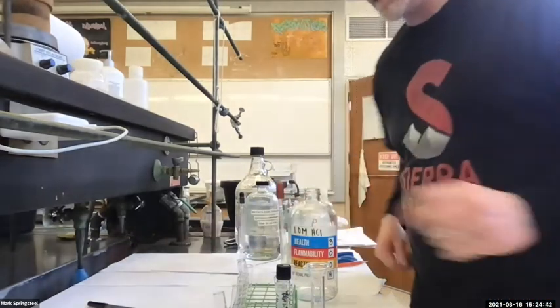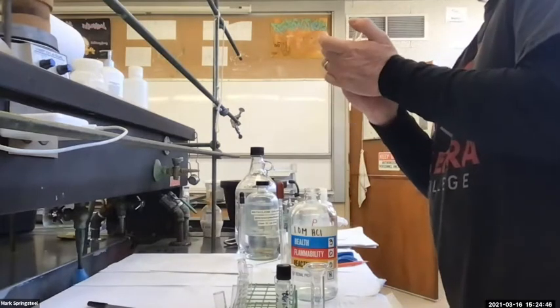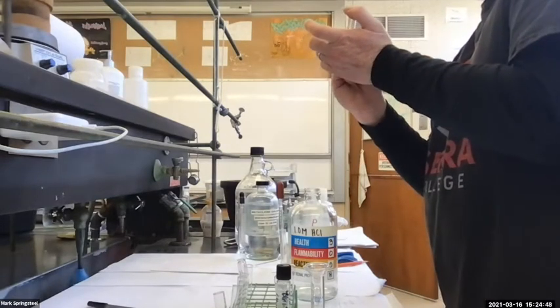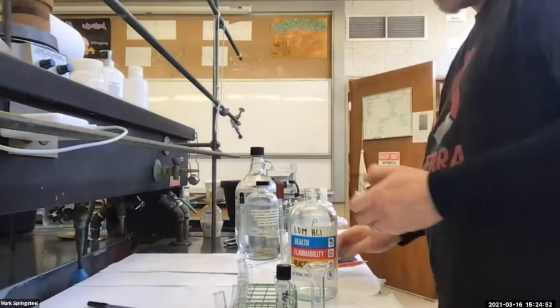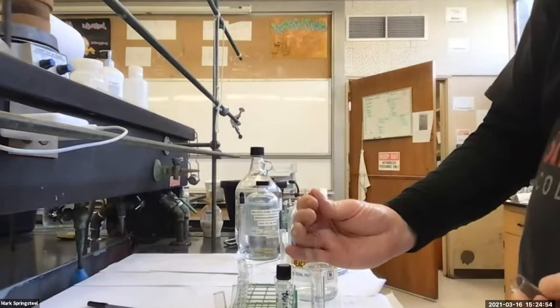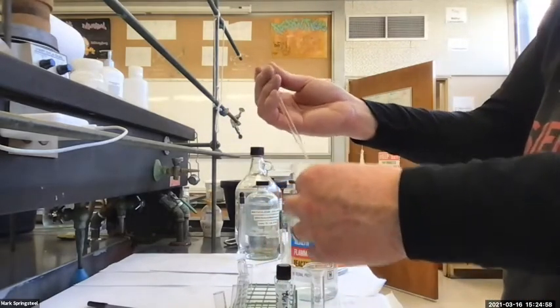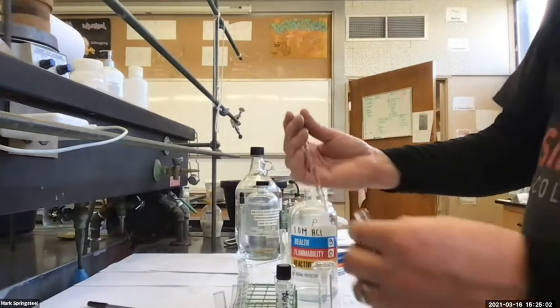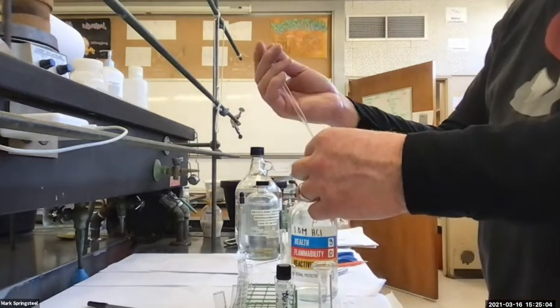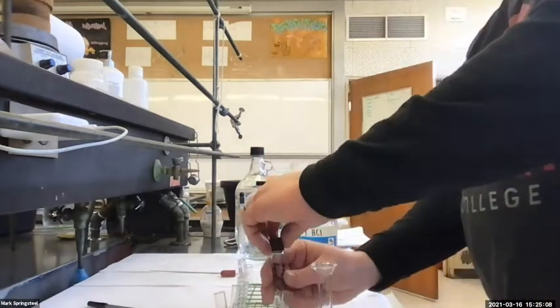Can I ask a question? Definitely. So will the benzocaine completely be in the aqueous solution, or will it still remain in the organic layer a little bit? I'm going to predict, from experience, that there'll still be some benzocaine in the organic layer. I'm going to check for it though by precipitating it. You'll see shortly, it'll make sense.